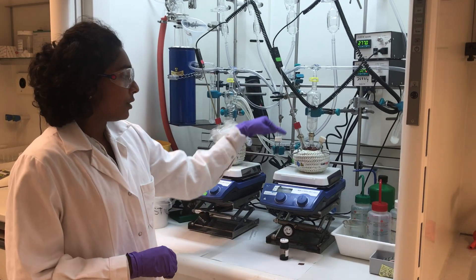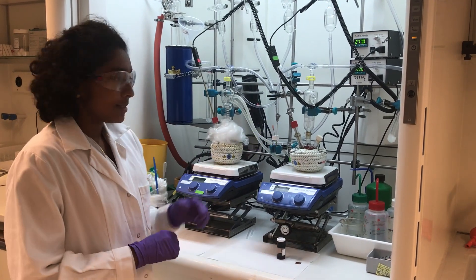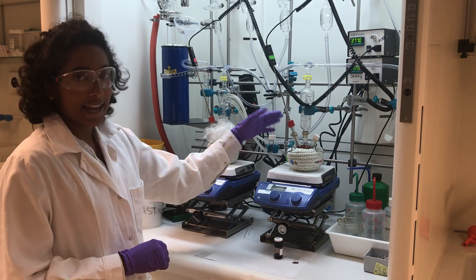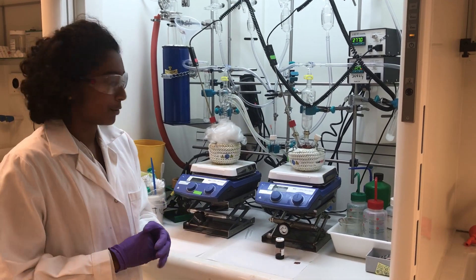We put the precursors in and start the recipe, which is the reaction, and then we continue the procedure.